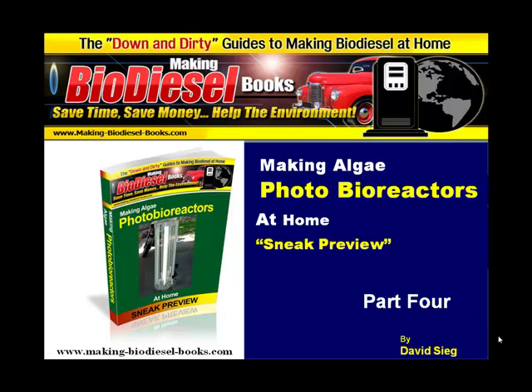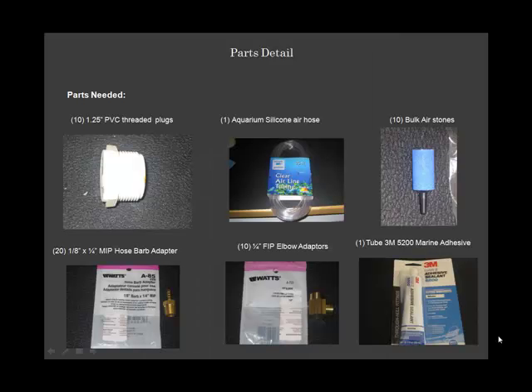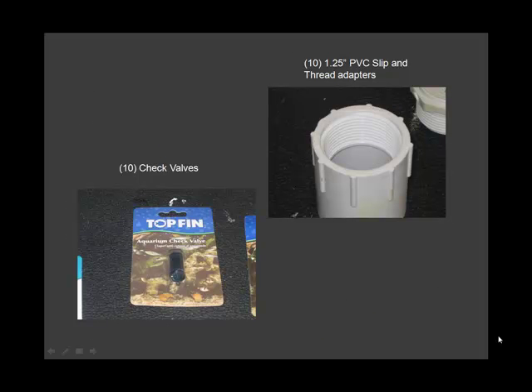Welcome to Making Photobioreactors at Home, Part 4. Today we will cover the cap assembly details. Here are your parts details for the assembly today. As you can see, the parts and also tools needed vary greatly today.